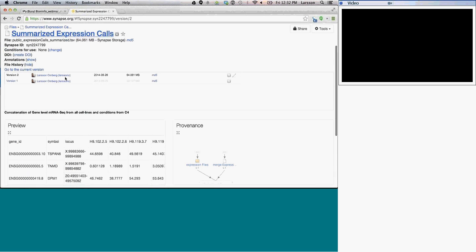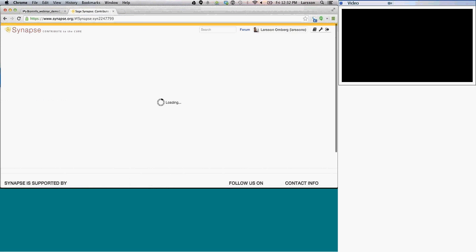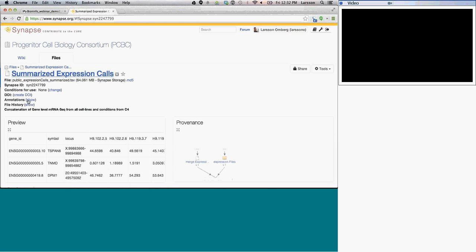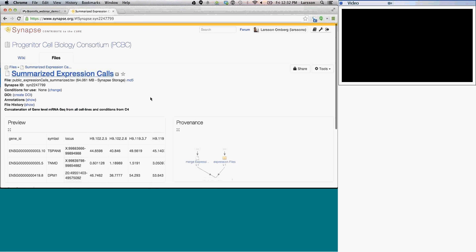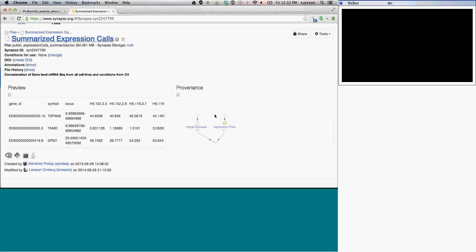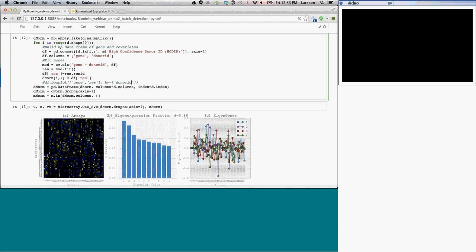And you can see there are multiple versions of this file. If this is version 2, we can go like that, and we can see that there's even more versions than that. And here also there's information about how this data set was created. Let's see how it would happen over here.